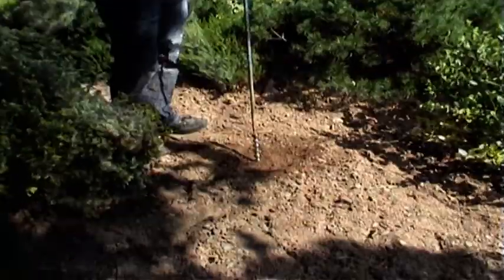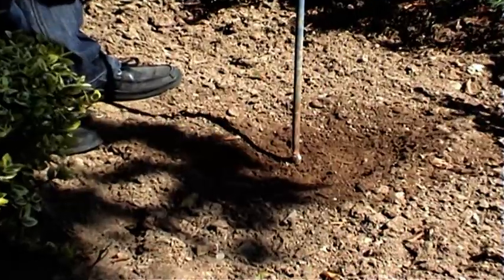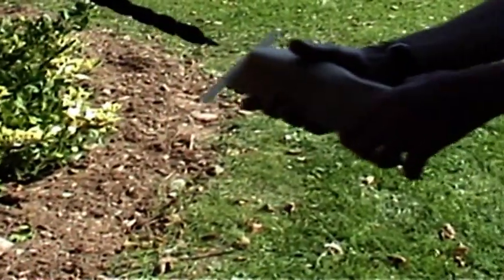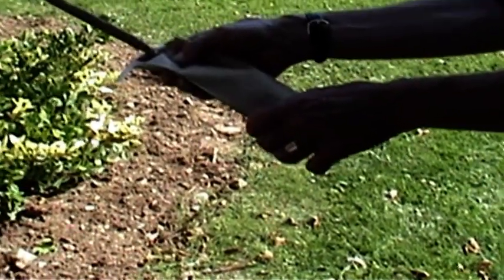It may be necessary to take samples at depth, for example, with an auger. Again, the sample is collected in a suitable container, here into a soil bag which is flexible.